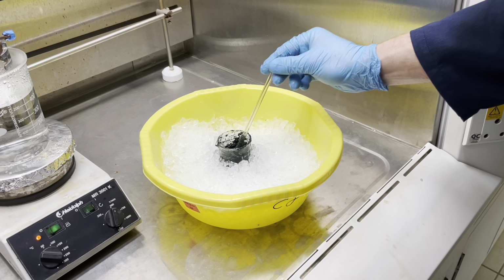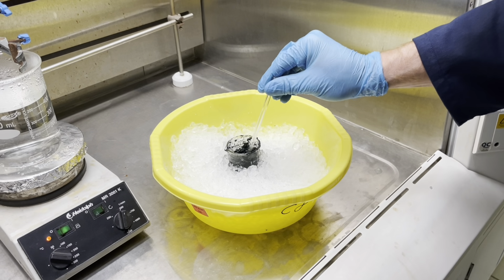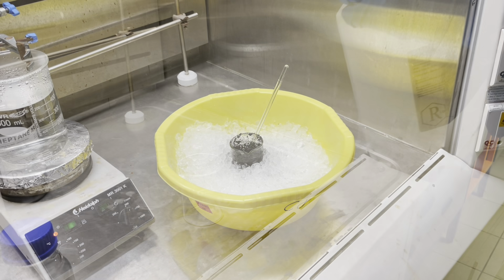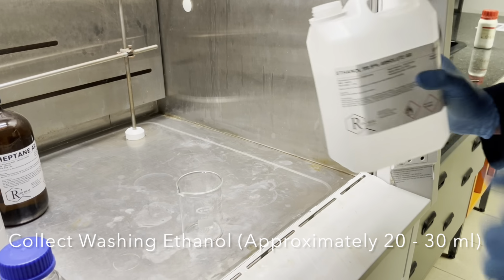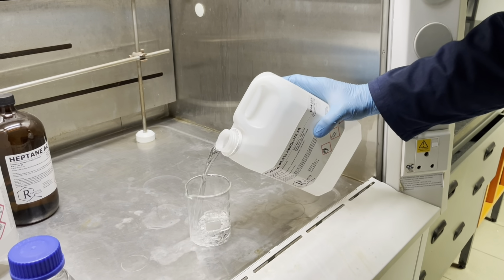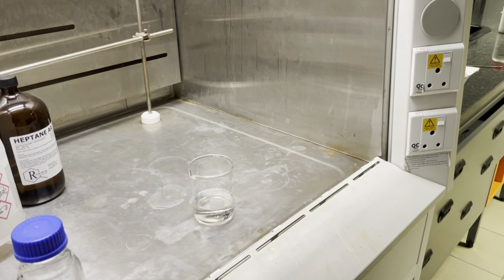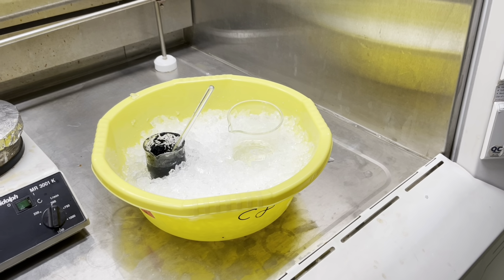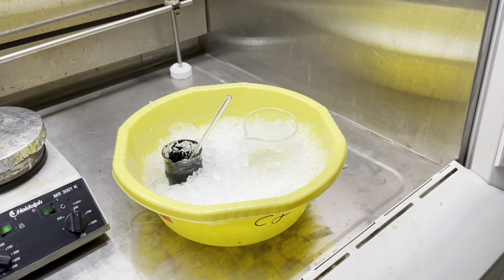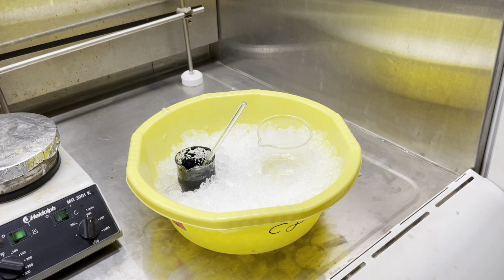Now place your reaction vessel in the ice for approximately 10 to 15 minutes. We will require cold ethanol to wash our product with. Collect some ethanol in a beaker, which you will also place in the ice bath alongside your reaction vessel, so it may cool down alongside it before you start the washing process.